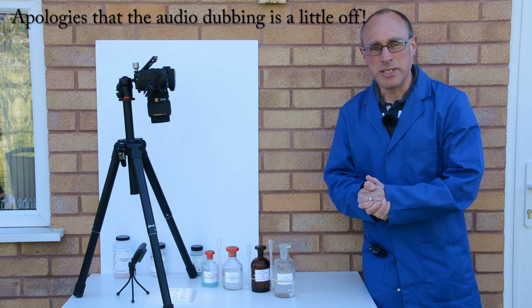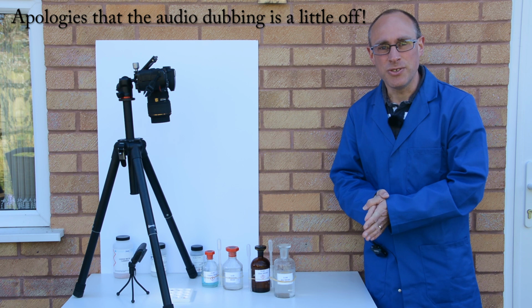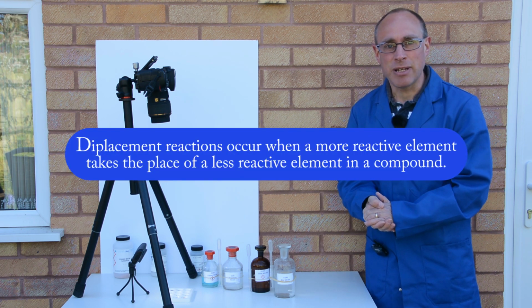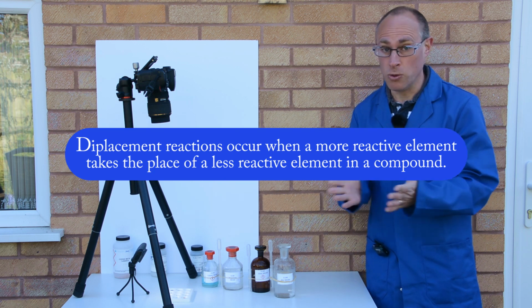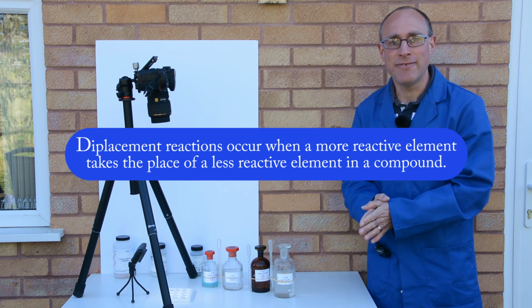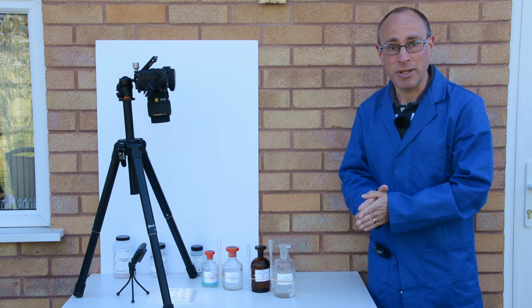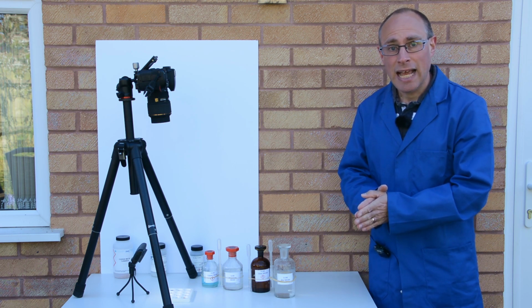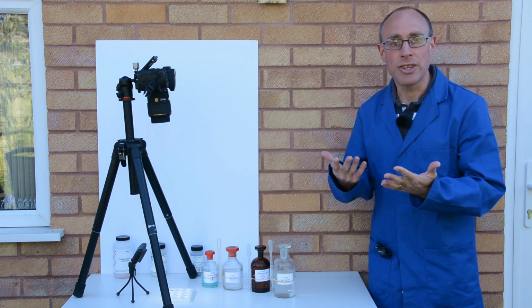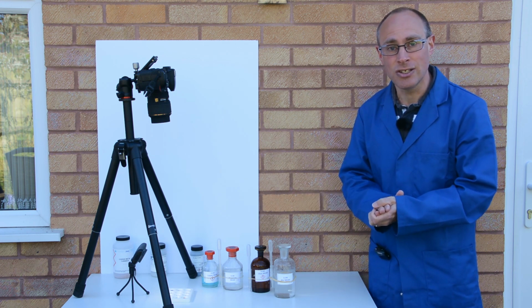So in this experiment I'm going to investigate the reactivity series of metals using displacement reactions. Now a displacement reaction takes place when a more reactive metal or element takes the place of a less reactive element in its compound. So for this experiment I'm going to look at the displacement reactions of metals, and I'm going to react metals of different reactivities with metal salt solutions, specifically nitrate solutions.